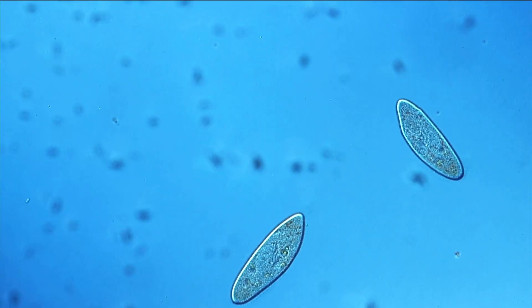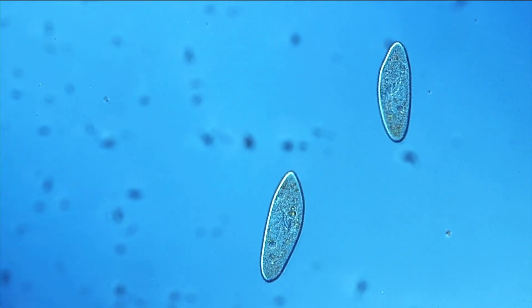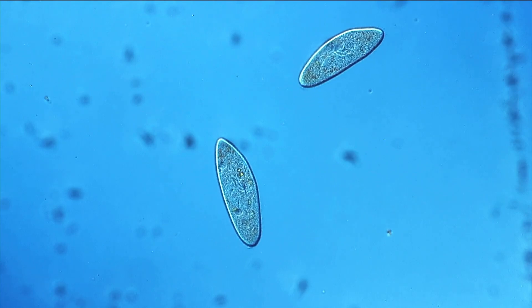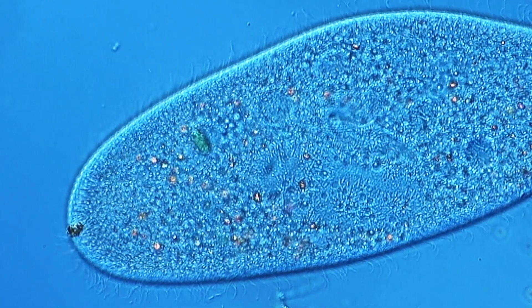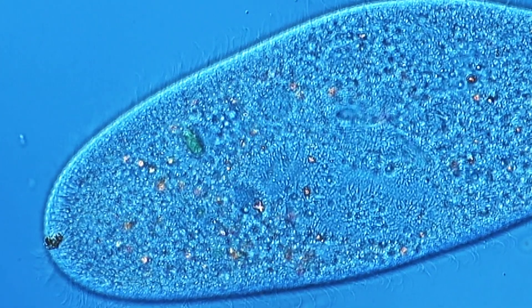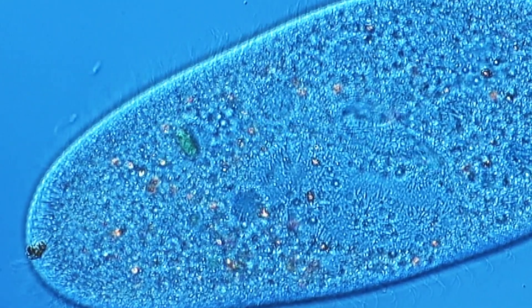And this has of course also another advantage and that is that because it's pressed so flat, pretty much all of the parts of the cell are in focus at all times. And this means that you're able to observe the cellular processes that are happening much better. For example, you're able to look at the cilia, which are the tiny little hairs that are moving, especially also around the mouth of the paramecium. You can also observe the contractile vacuole, which pumps out water.